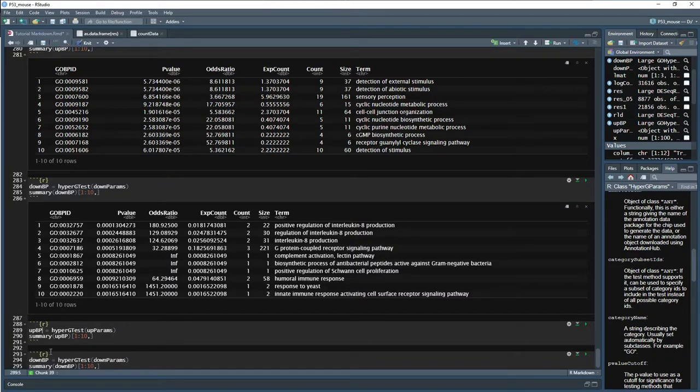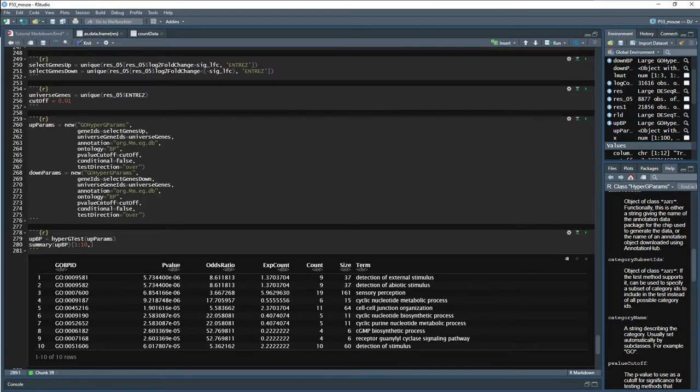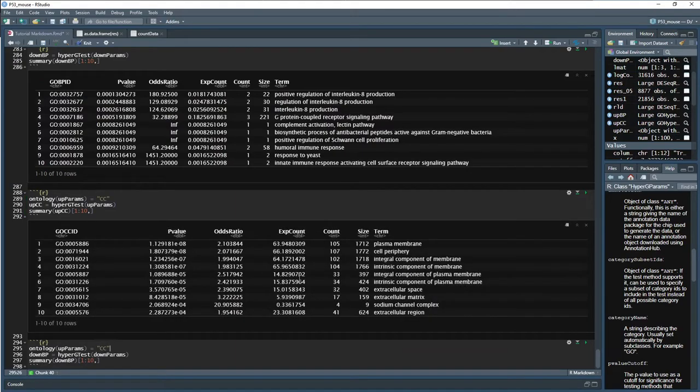Next one, let's look at cellular component. Up CC, copy this guy. And then in order to go to the next thing, now we need to set that category. So up here we set ontology equal to BP. Now we need to set ontology of our up params equal to CC, so cellular component. So if we go ahead and set that, then we can run these other two and we should get the cellular component upregulated in P53. So here we go.